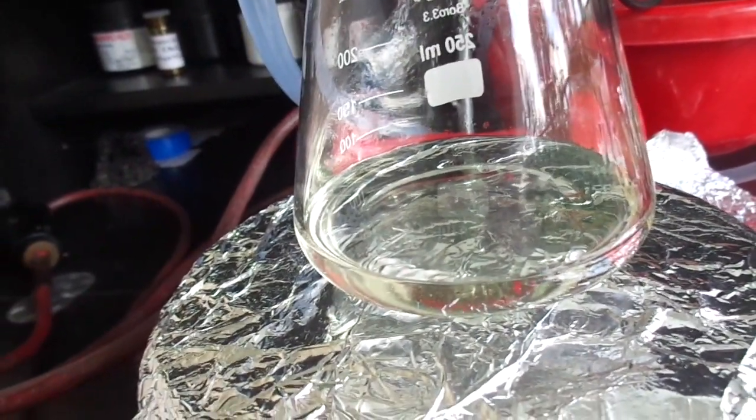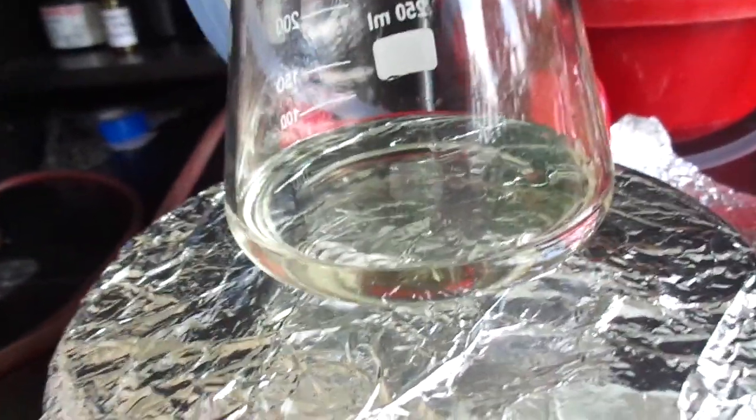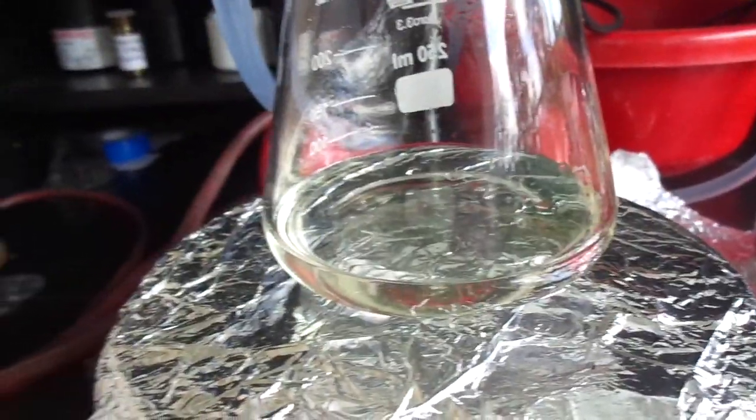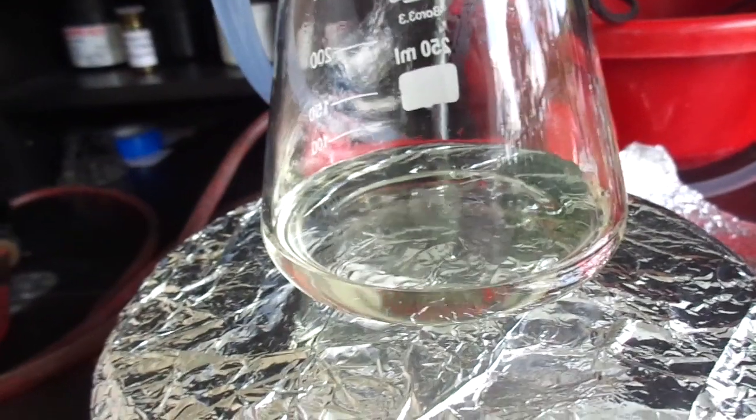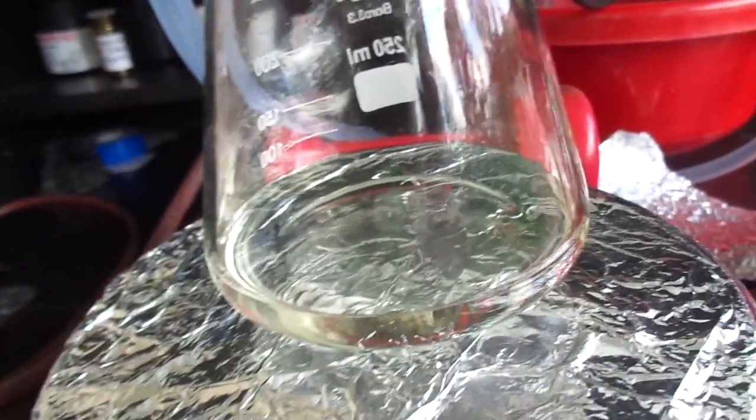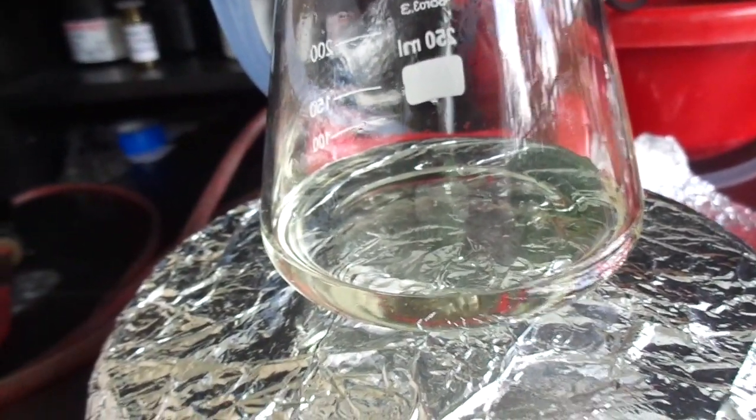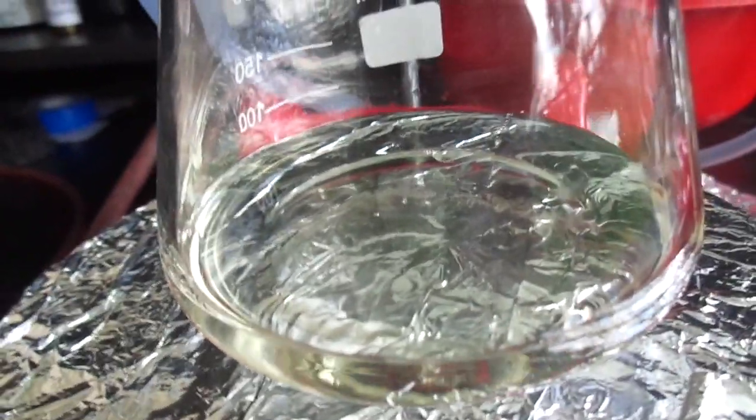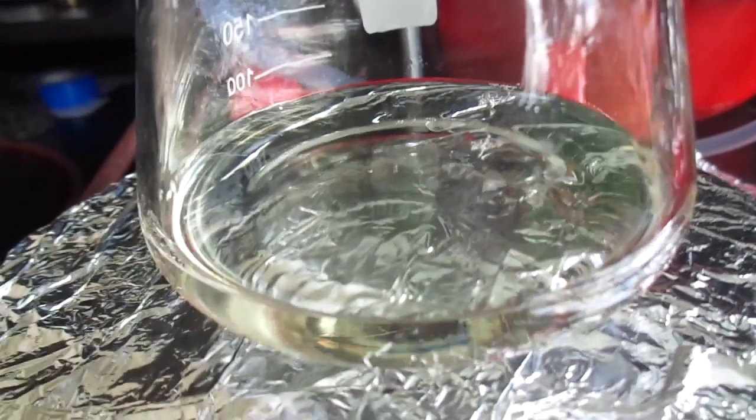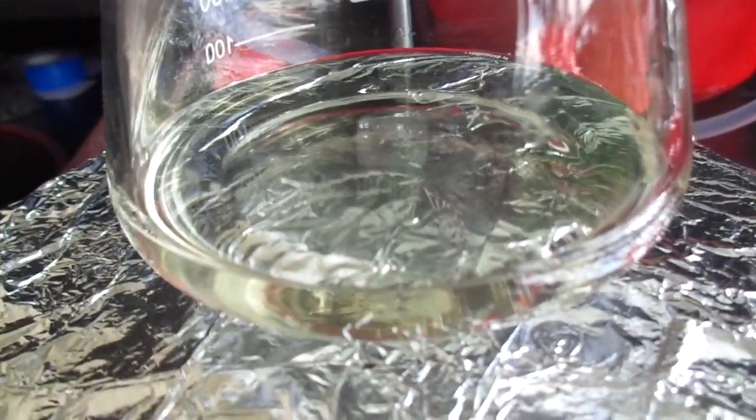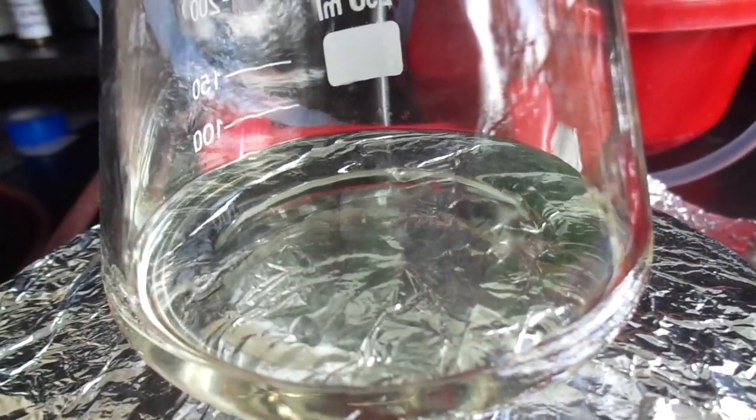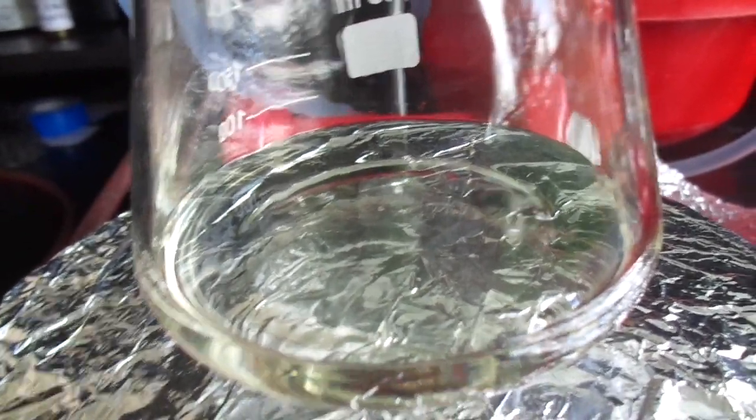And when I added the sulfuric acid to catalyze the reaction there was a bunch of calcium sulfate formed and it also neutralized the sulfuric acid. So I had nothing else to catalyze this reaction. So I filtered it, added some more acid and I'm again refluxing it.